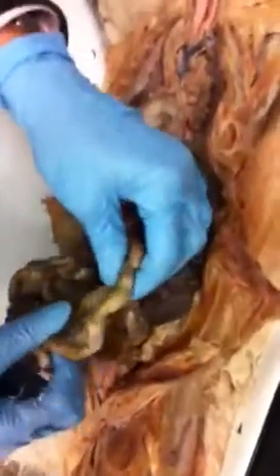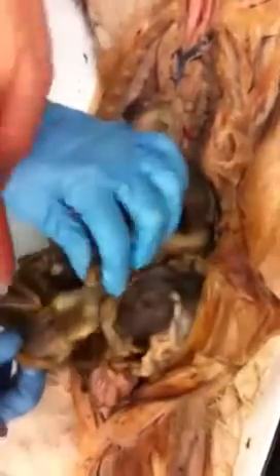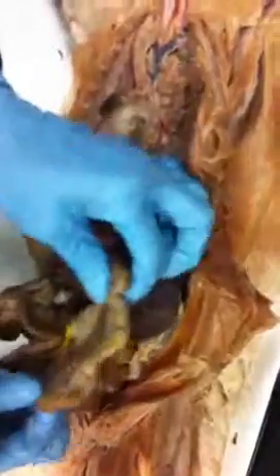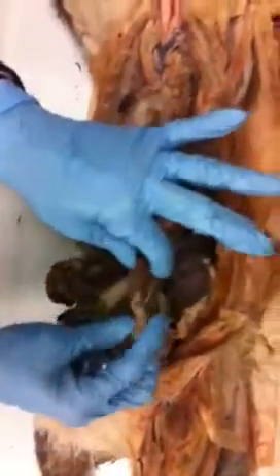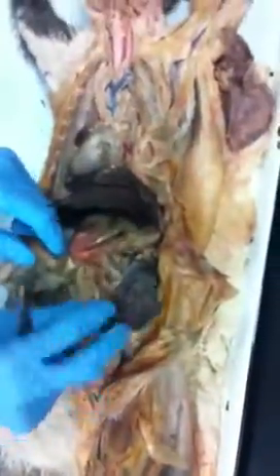Okay? So we go all through the jejunum, and then this last couple of centimeters. What is this right here? I'll tell you in a second. Okay. This last couple of centimeters of small intestine is the ileum. And the ileum leads to the large intestines.